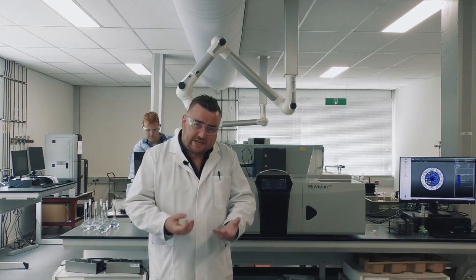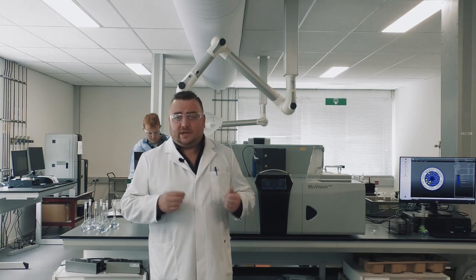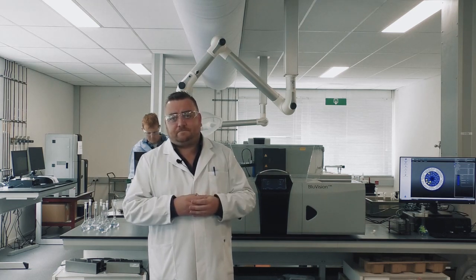So some things like ammonia, which are very volatile and very soluble, you don't want those to pass from sample to sample. Those will come out and they are immediately taken down and away from the other samples. You do not have this carryover from sample to sample in the sample racks themselves.